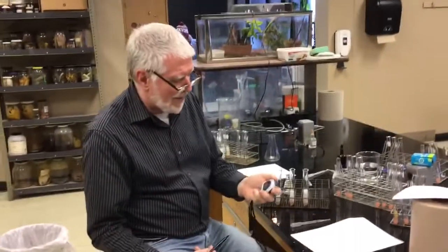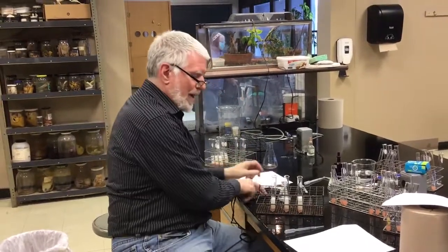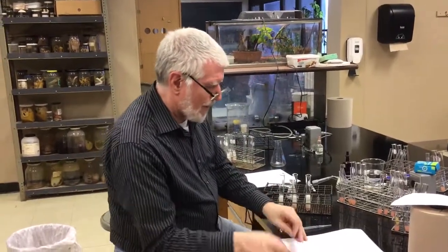You saw the trials happen. You get to decide what to use and what not to use. And you've got a couple of questions there. Okay, that's it for the temperature test.